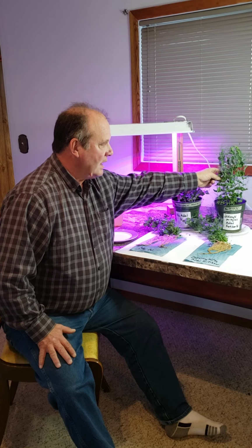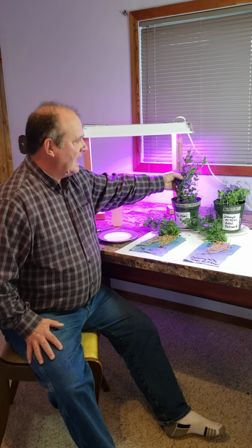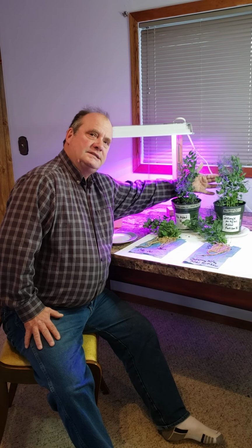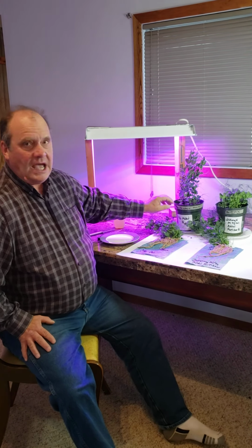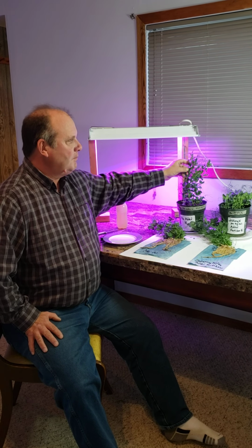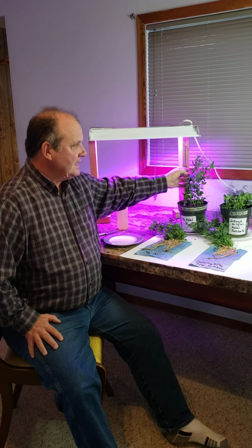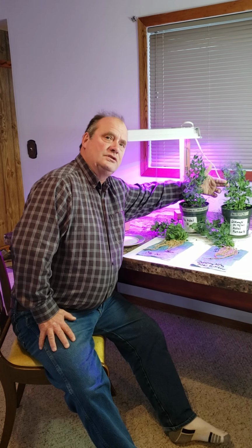And we can see here comparing the nitrogen fertilized and inoculated pea plants to the pea plants that had seed inoculant but no nitrogen fertilizer added, you can see that the growth of the pea plants in the two different treatments is very similar. Earlier on, the treatment without the added nitrogen was a little bit slower. It was a little bit shorter in height. But as you can see, once nitrogen fixation began and the nodules established, the treatment without any added nitrogen began to catch up and has nearly approached the growth of the treatment with the added nitrogen fertilizer.